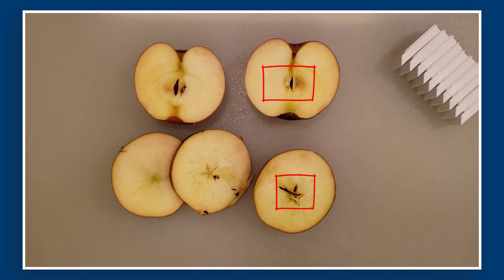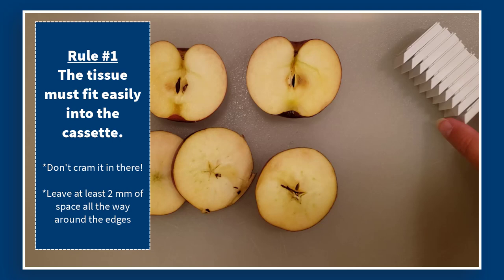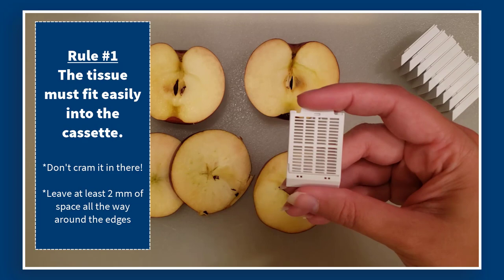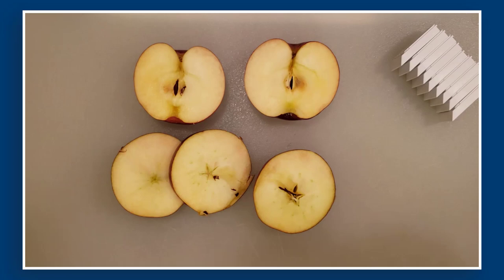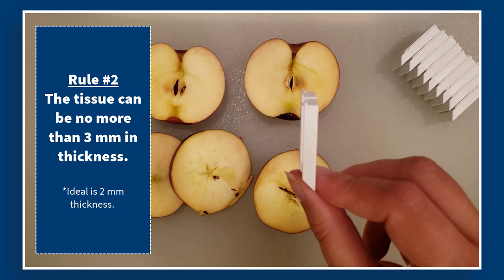Once you've decided what type of tissue you want to take, there are a few key rules to remember for histology sectioning. Rule number one: the tissue can be no bigger than one of these cassettes — this is what our tissue is going to go into and everything needs to fit in there. Rule number two: the tissue can be no thicker than this cassette, so it shouldn't be more than three millimeters of thickness, or we won't be able to run it through the histology processors and the histotechnologist won't like you at all.